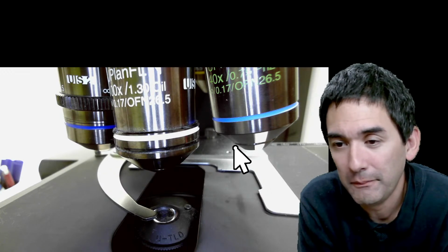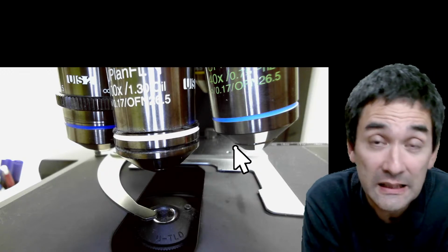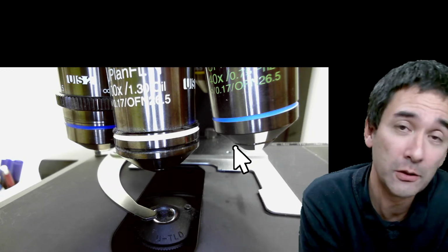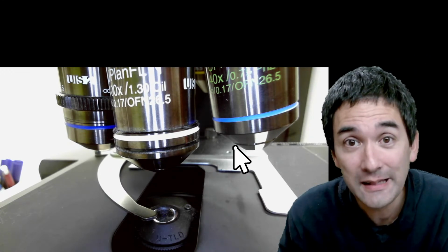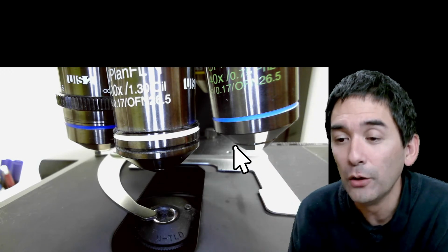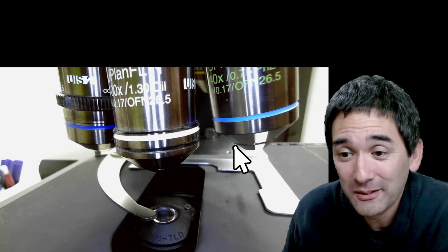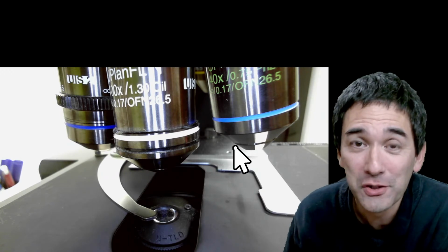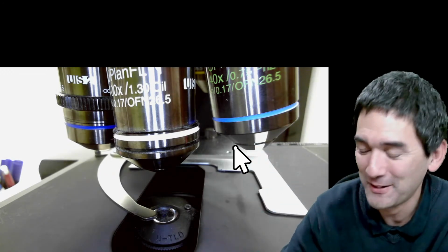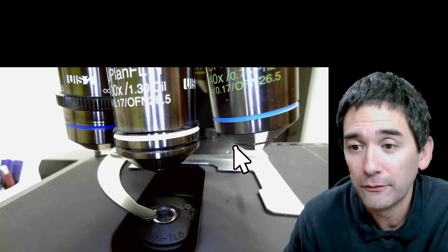There are still lots of halogen microscopes around, and there are more and more LED microscopes around. I would say if the halogen is brighter than the LED, then halogen is better. Both have advantages and disadvantages. And with the old mirror, if you use a mirror, then you can use a flashlight, and then you can of course also adjust the color of the light. So I think I'm just going to leave it at that for right now.